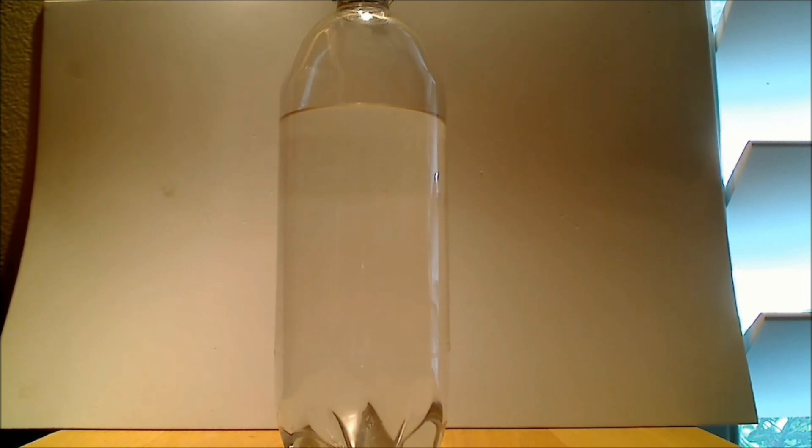But if you add a little salt, and I've added salt to the mixture, it turns out the salt, although it's very soluble in water, is not very soluble in isopropyl alcohol. And this causes the two phases to cease being miscible.